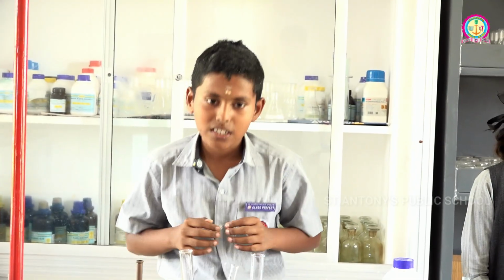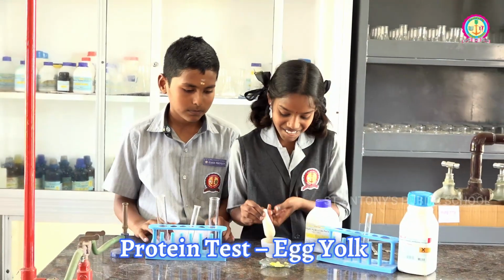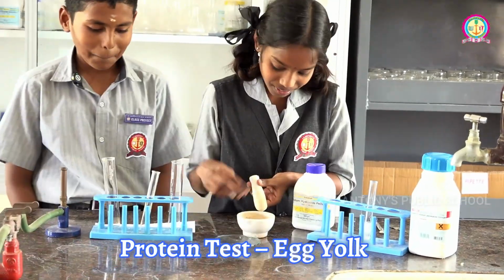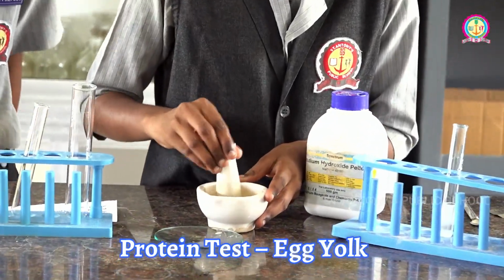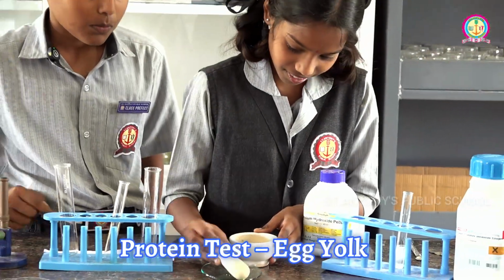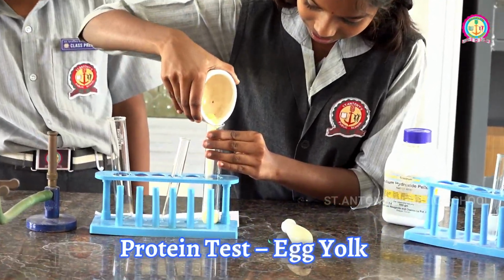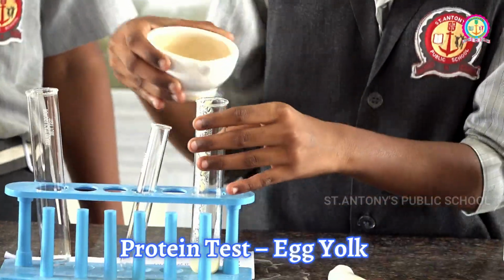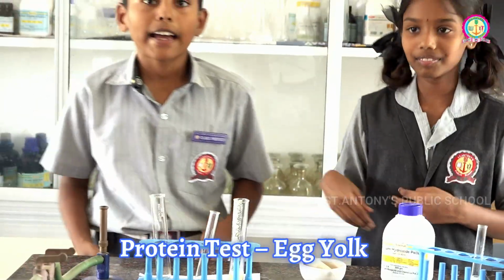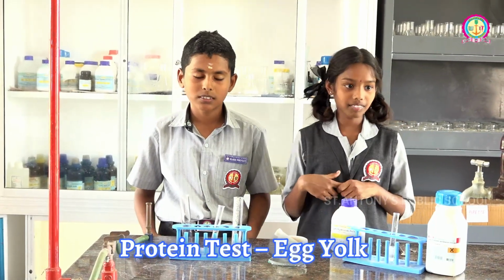Good morning everyone. Today we are going to demonstrate the protein test. First, take the food sample in the test tube. It is egg yolk. Add few drops of caustic soda, that's nothing but sodium hydroxide.